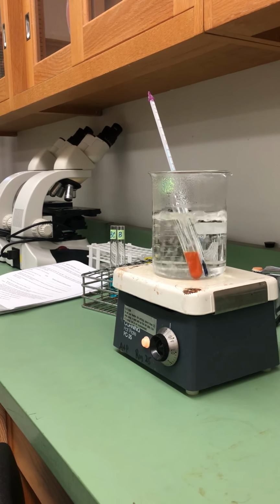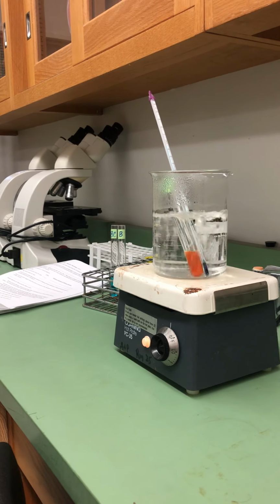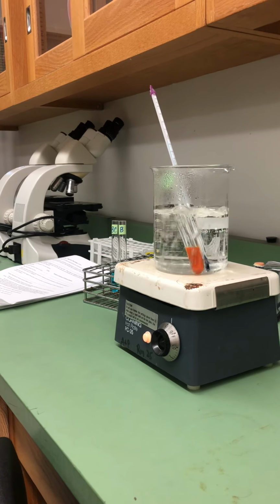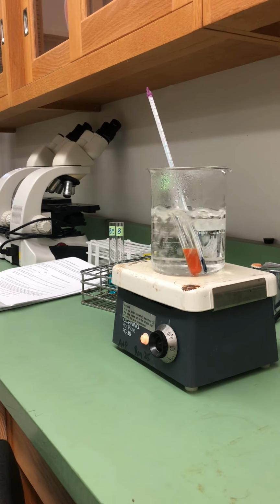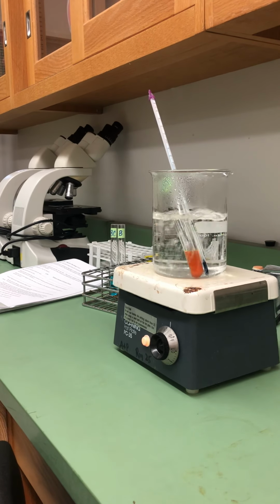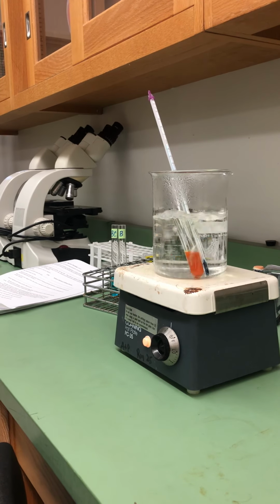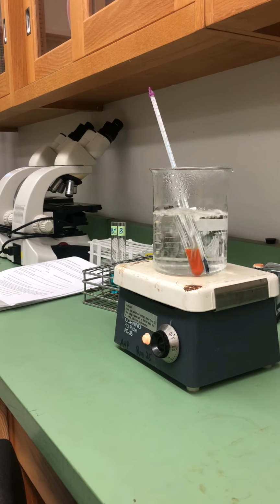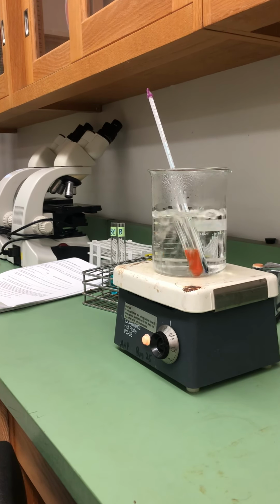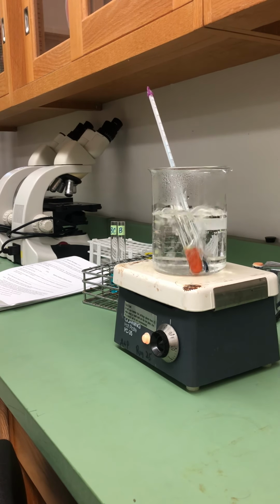This test tube and the observations we make now is what we're going to look to see happening with our test tubes that contained amylose, potato starch, with amylase enzyme, and the control that did not have amylase enzyme. And when we see a color change, that would be an indication of amylose, potato starch, having been broken down from the action of the catalyst we call amylase.